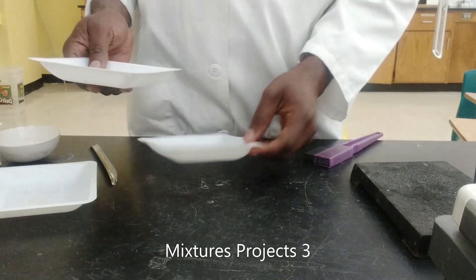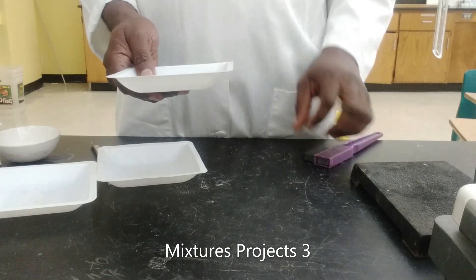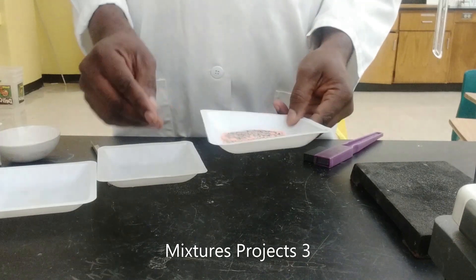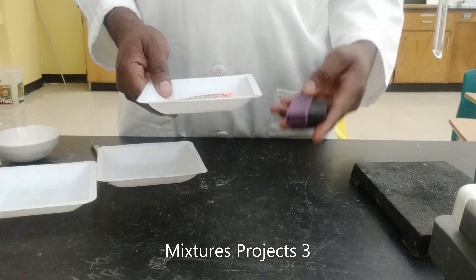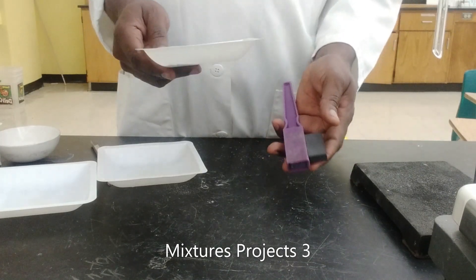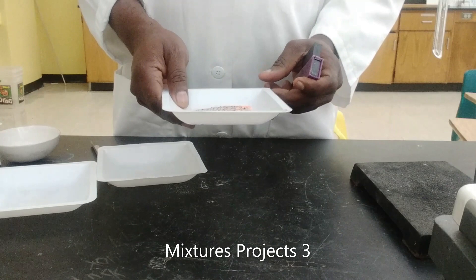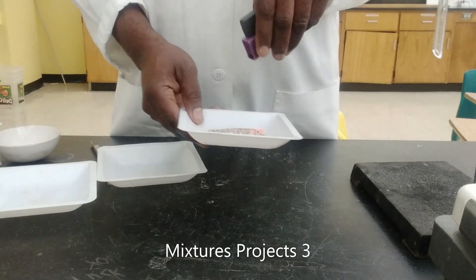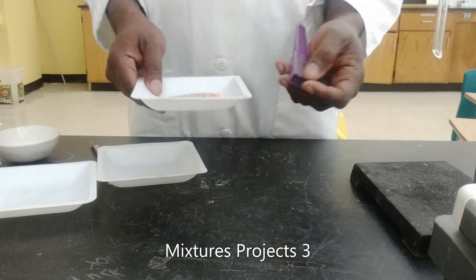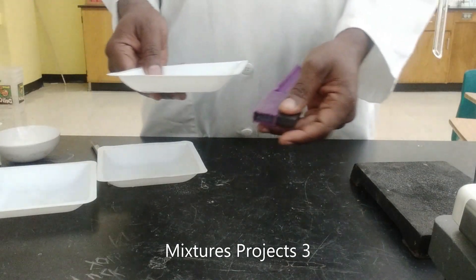First I would like to separate the iron, because that is the easiest to get out of the mixture. What property of iron am I going to use? I know that iron is ferromagnetic, meaning that it has some magnetic property, and right here I have a magnet. So what I am going to do is place the magnet under the dish. I usually advise: do not place the magnet inside the mixture because you would have a little bit of difficulty trying to remove the iron filings from the magnet.